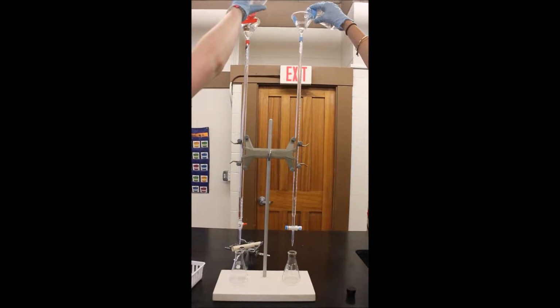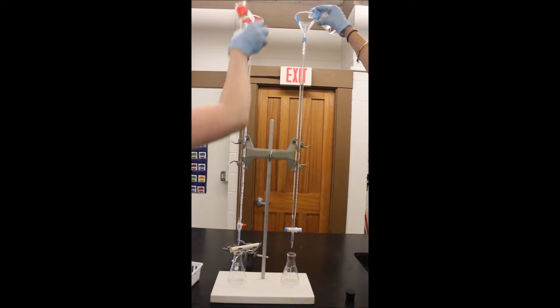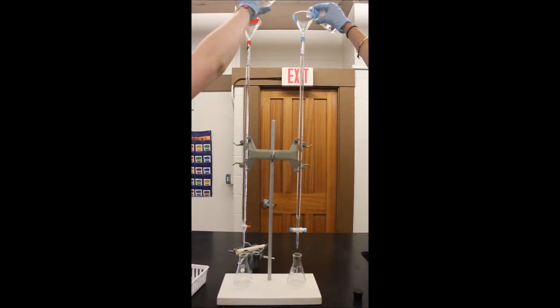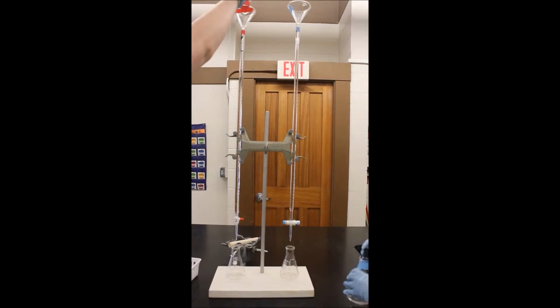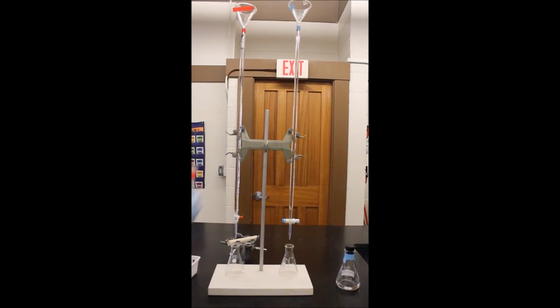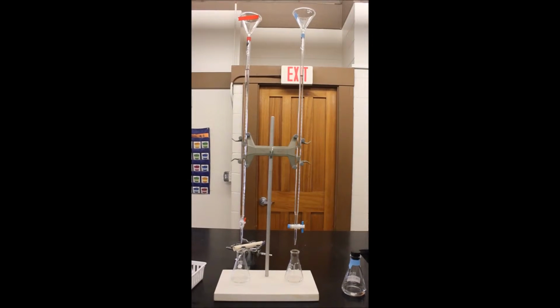The acid burette was rinsed 3 times with the acid that was used in the titration. Then the base burette was rinsed 3 times with the base solution that was used. The first burette was filled to a point above the 0 milliliter calibration mark with the acid of unknown concentration. Some acid was released from the burette to remove any air bubbles from the tip and to lower the volume to the calibrated portion of the burette.